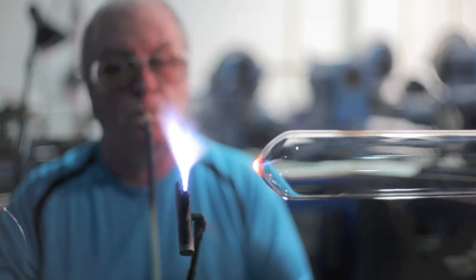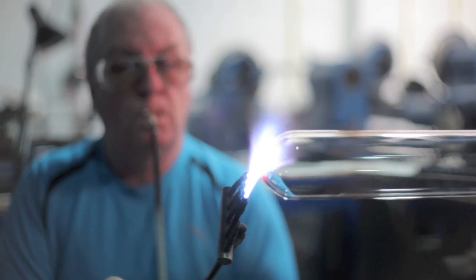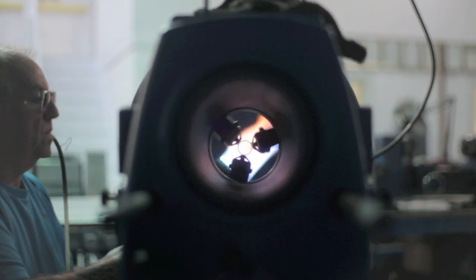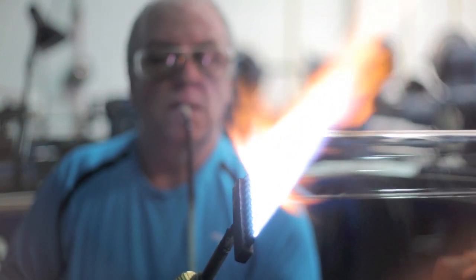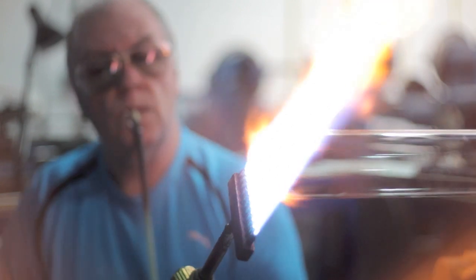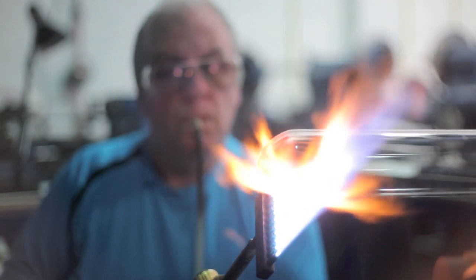Now we have got to get that nice and round. Get an even wall thickness. Go on to the bigger burner now, just so we can heat more. Get the heat in the right place and blow at the right time. It is coming up nice and round.